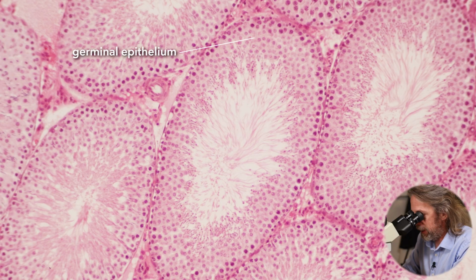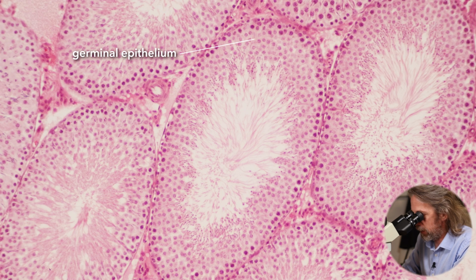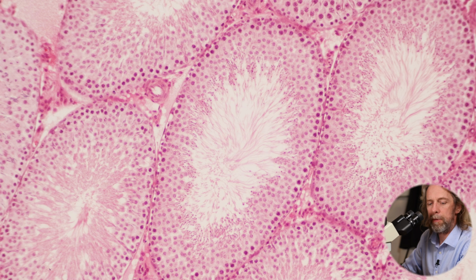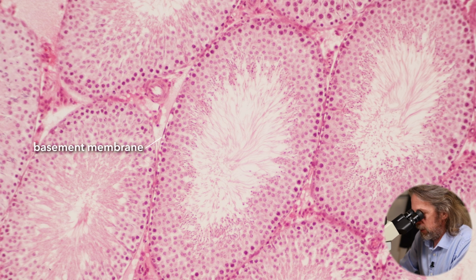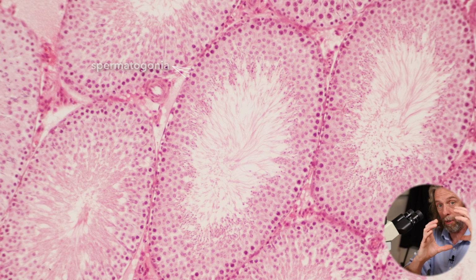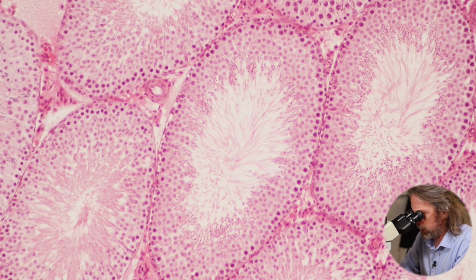Okay, so what have we got here? Well, it's another epithelium. So if we handle the spermatozoa side of things first, it's a seminiferous tubule, so around the edge of the seminiferous tubule there's a basement membrane supporting the epithelium. The cells around the edge there, that's where we find the germ cells. These are the spermatogonia, and we're looking at the darkly stained nuclei. The spermatogonia, the germ cells, will constantly produce more spermatozoa throughout life. They'll always be producing more spermatozoa, which is why old men can still be fertile.